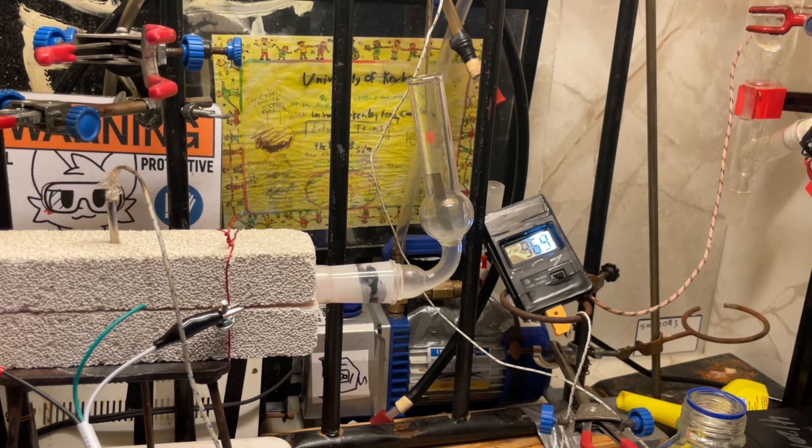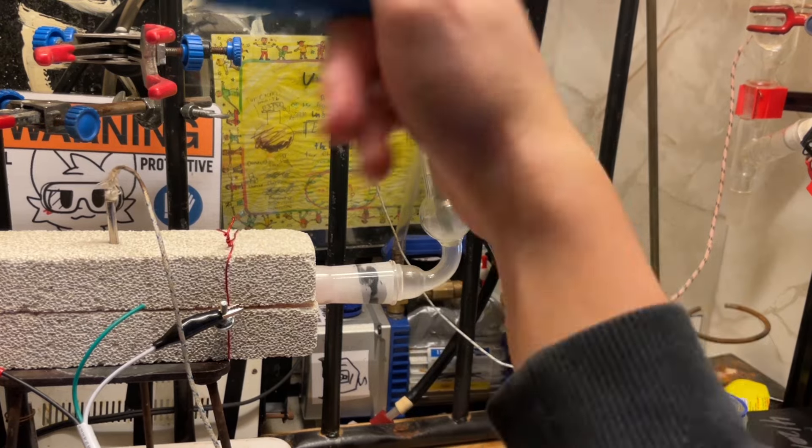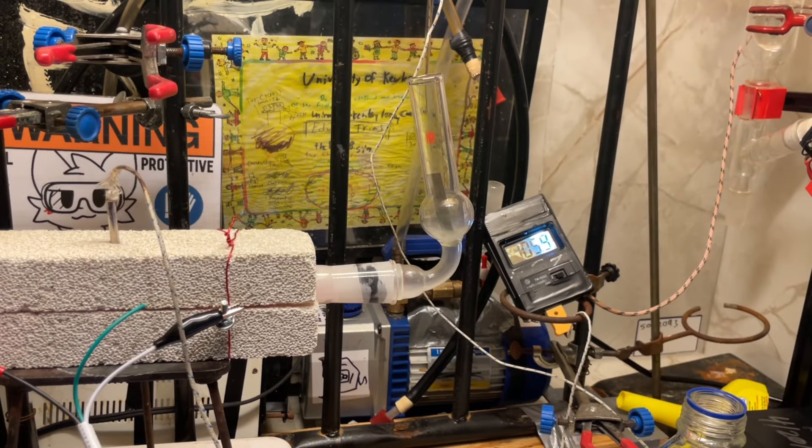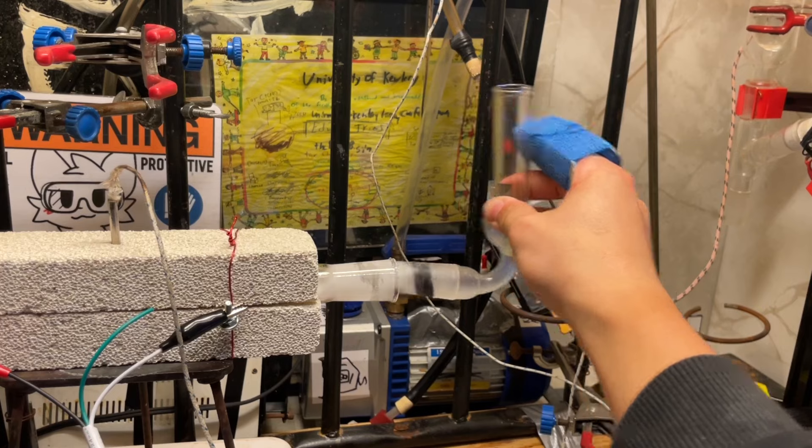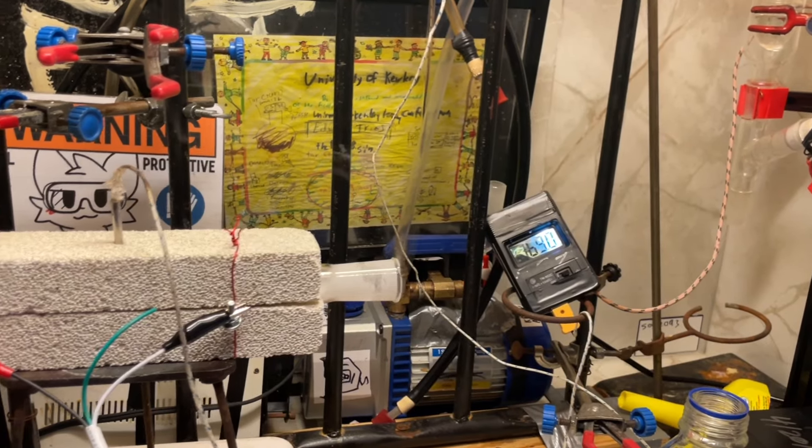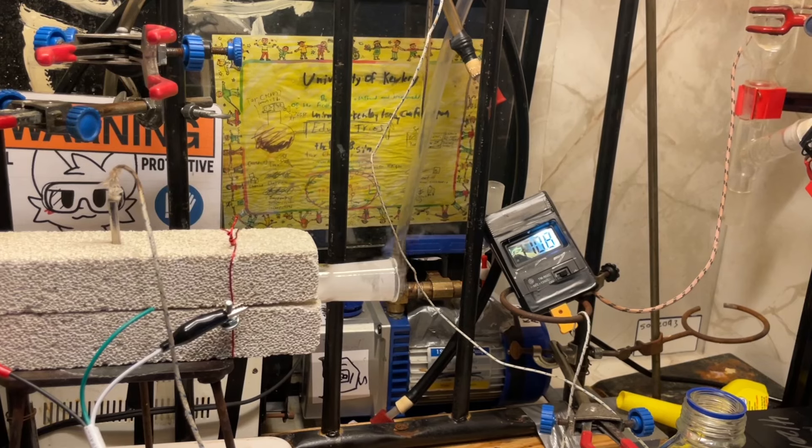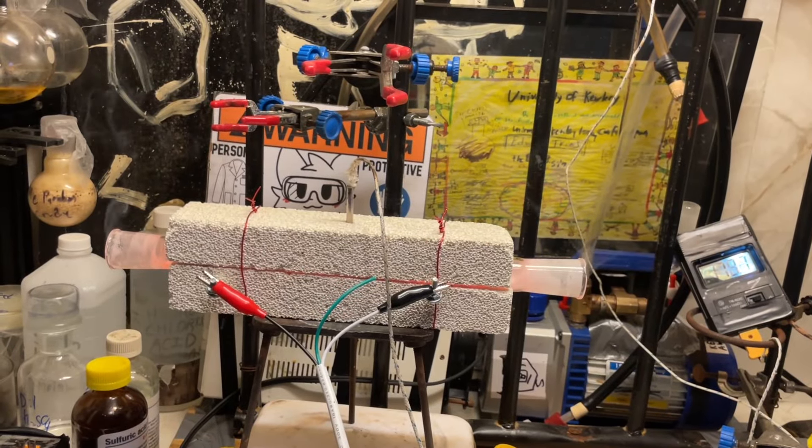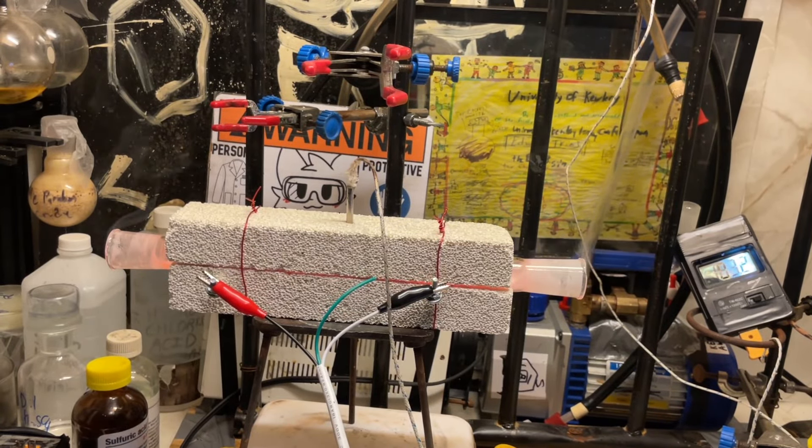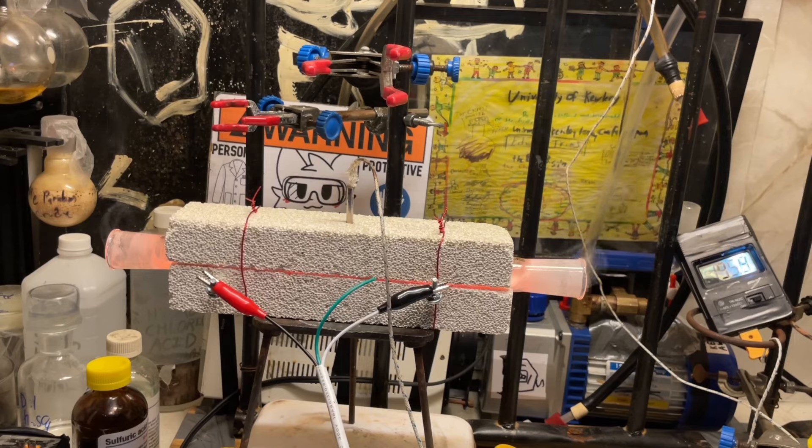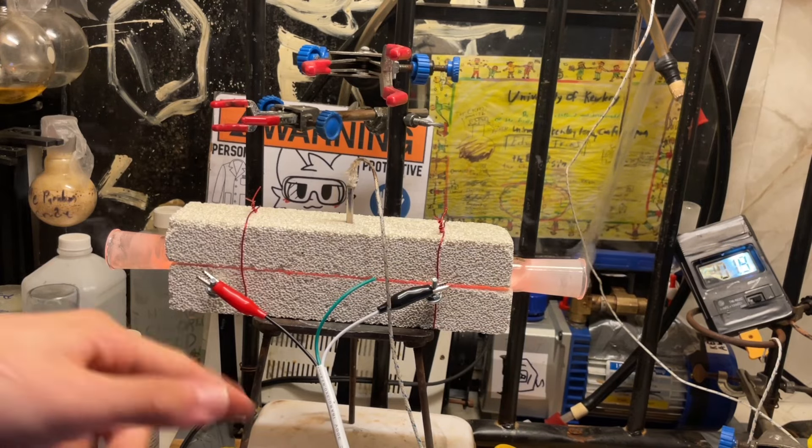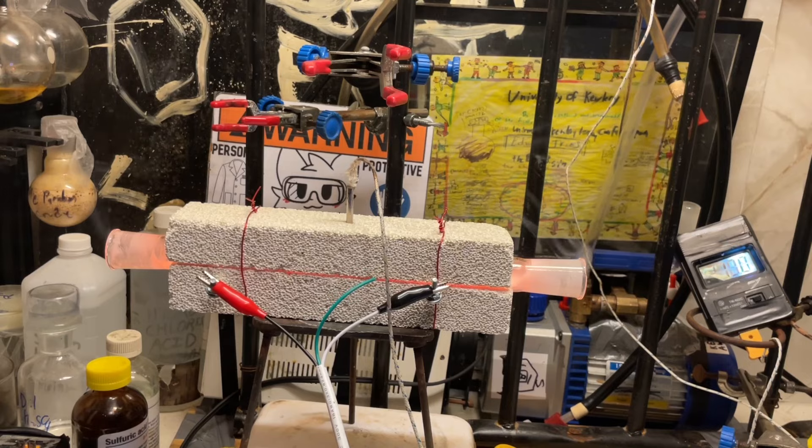Quite nice. And of course, just to make sure this is ammonia. Faint smell of ammonia. Not very strong. Sounds like the decomposition is done. And I will simply remove both ends of this. That's the ammonia smell. The nice thing about having a tube furnace is that you can just crank it up to full power and let air burn out any impurities you have in there. In this case, everything in there should be organic. So a quick burn out should just get rid of all that.